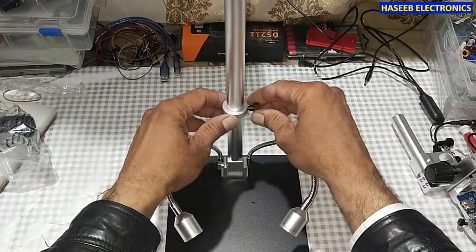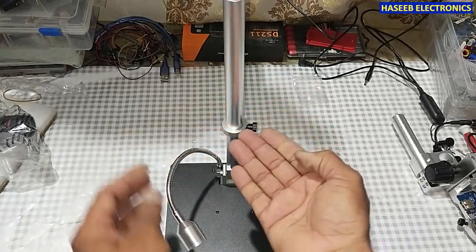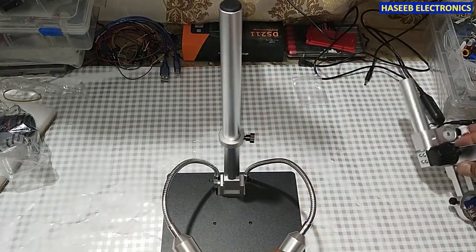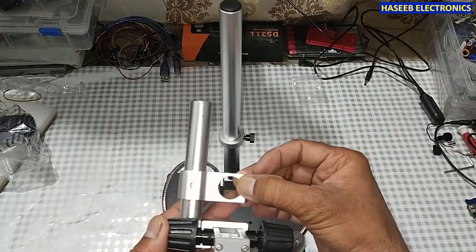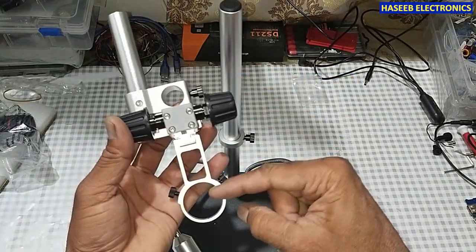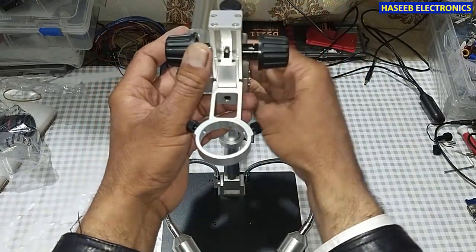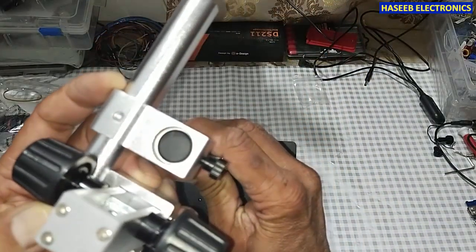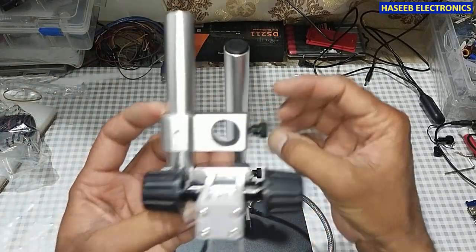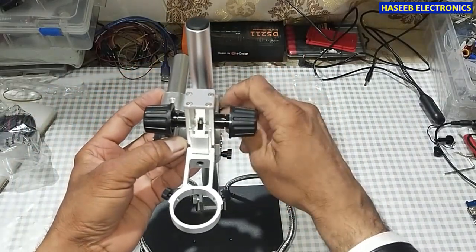This is the maximum depression limit, so we will align this ring to limit the vertical movement. We will install the microscope here — this hole will fit onto the vertical beam. Loosen this screw, insert the beam here, and tie it here.